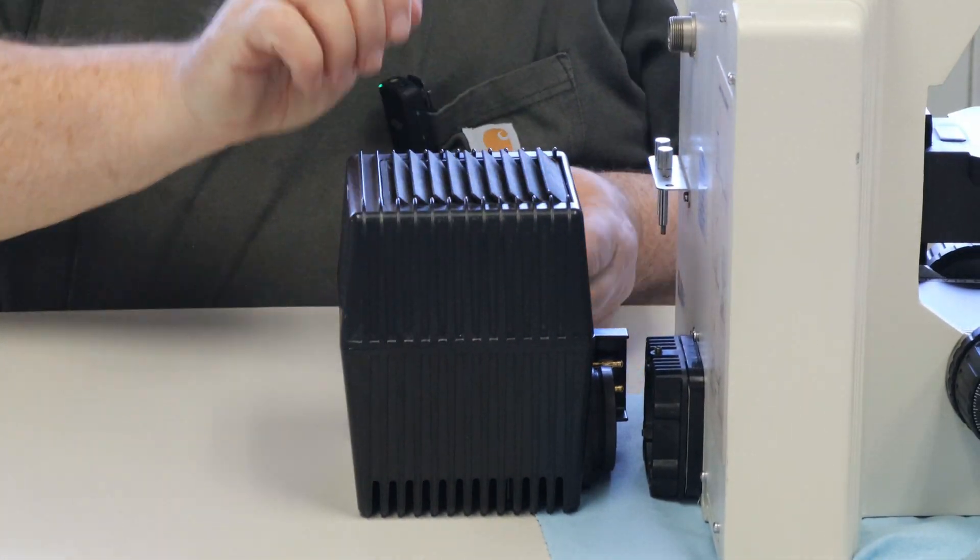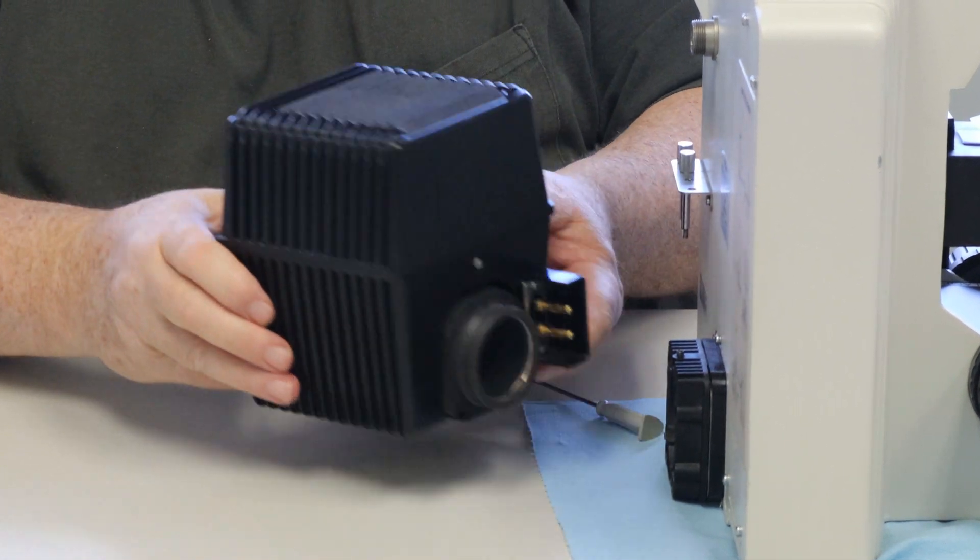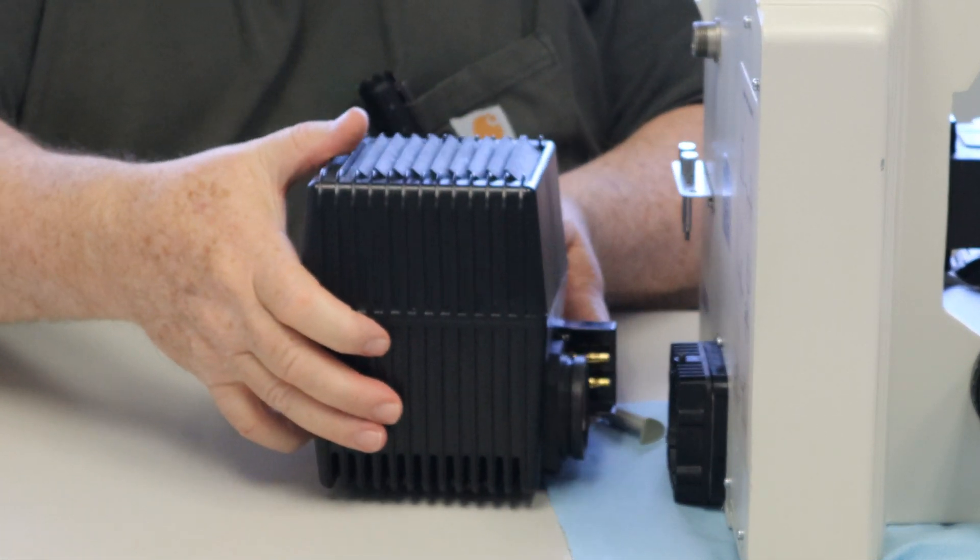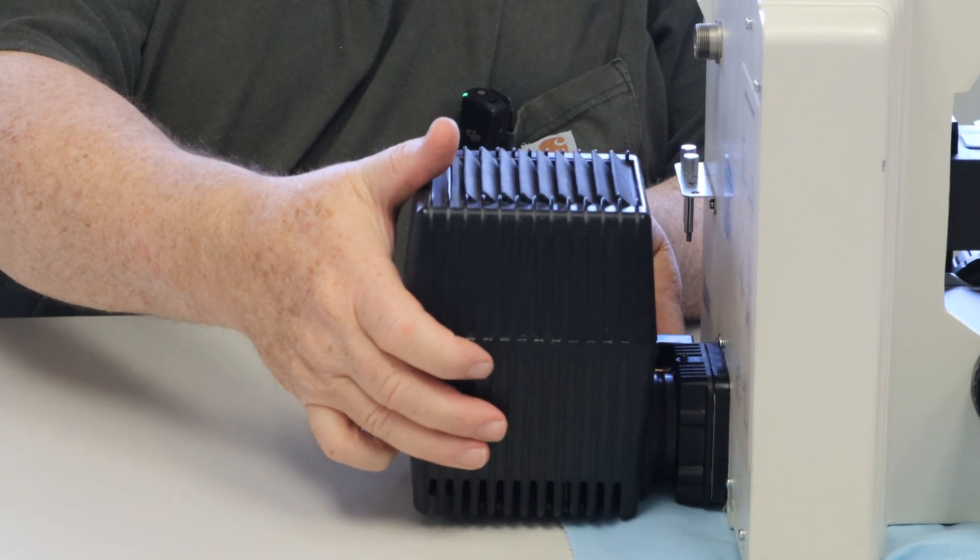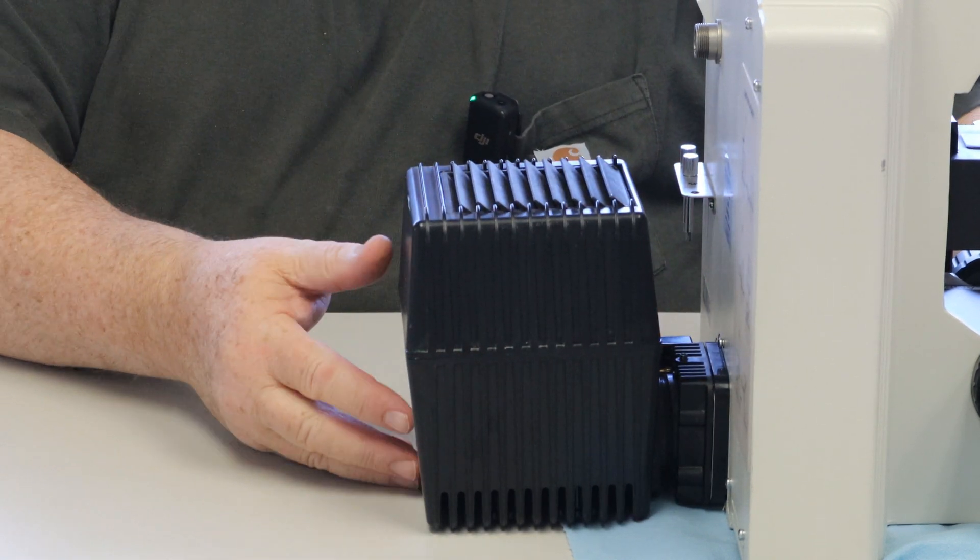Bringing it back up. Align your connection points with connection points on the microscope. Gently push in.